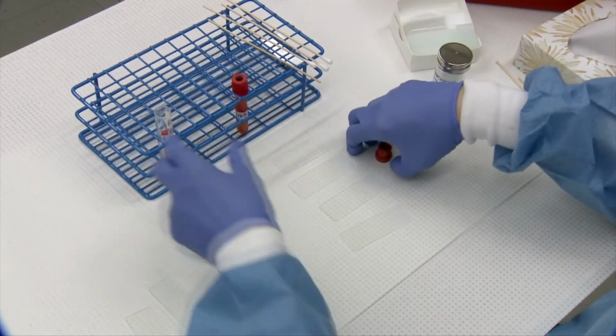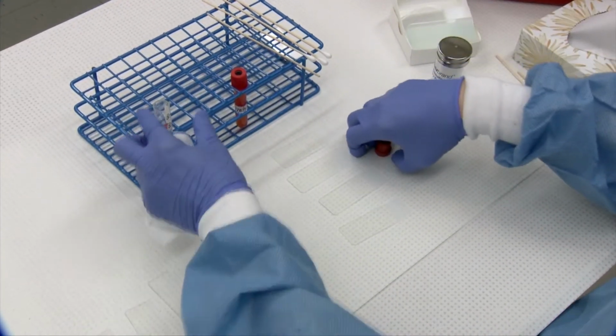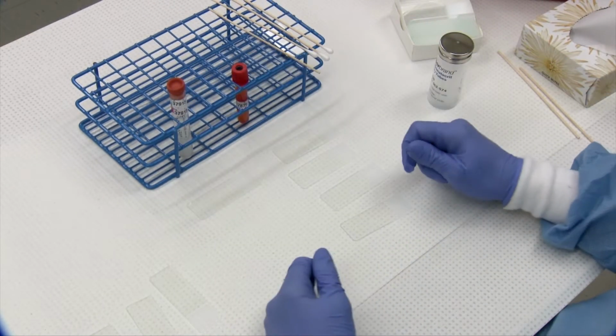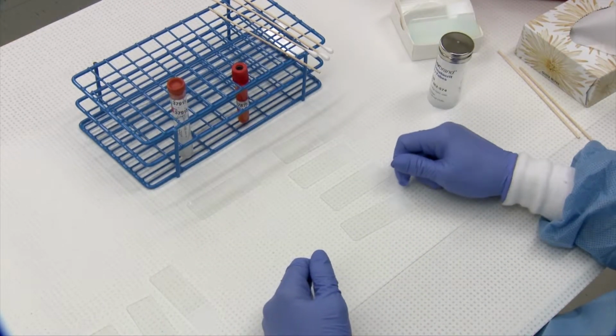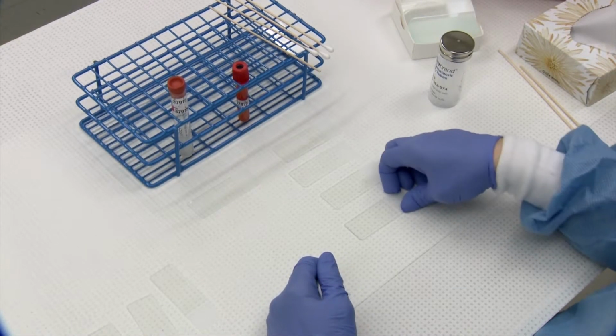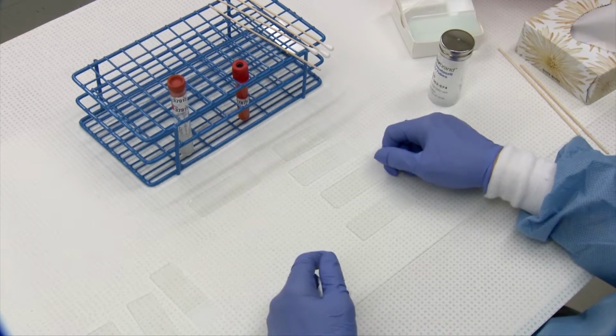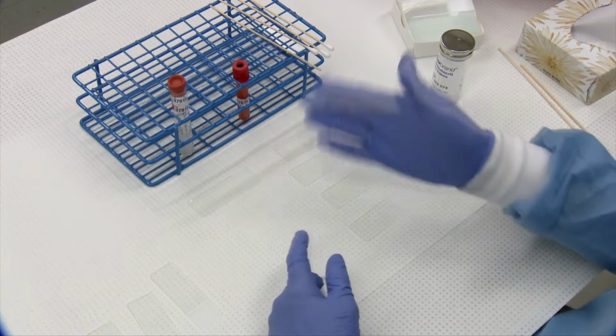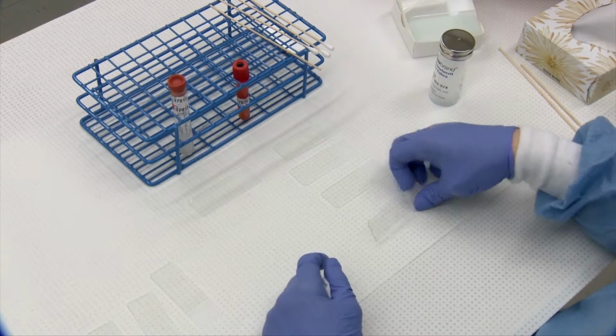The other thing about fluids that is important upon submission is to submit them in EDTA tubes. You can use a red top one for culture, but EDTA provides the opportunity for your sample to not clot if there is blood present. As you can see, these are not purple top tubes, but that is our wish.